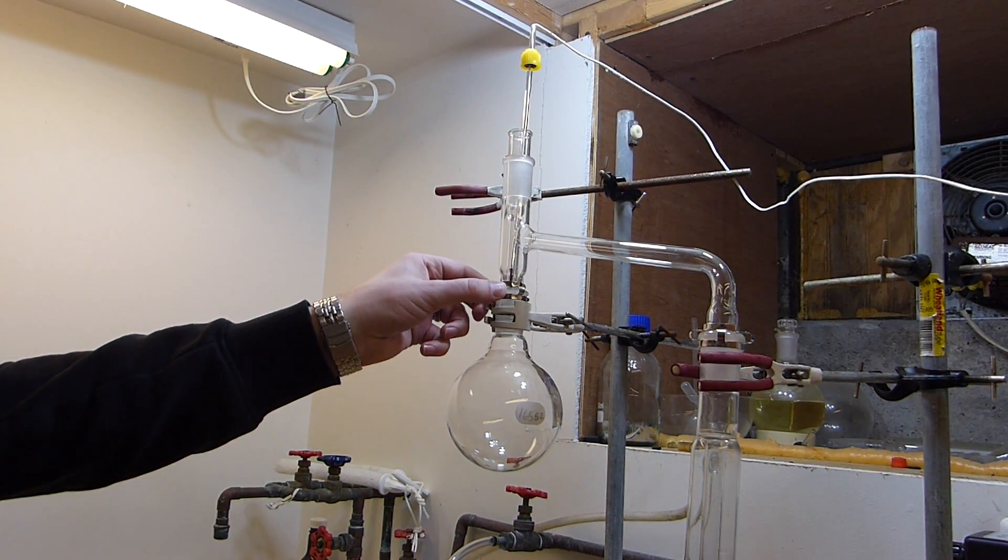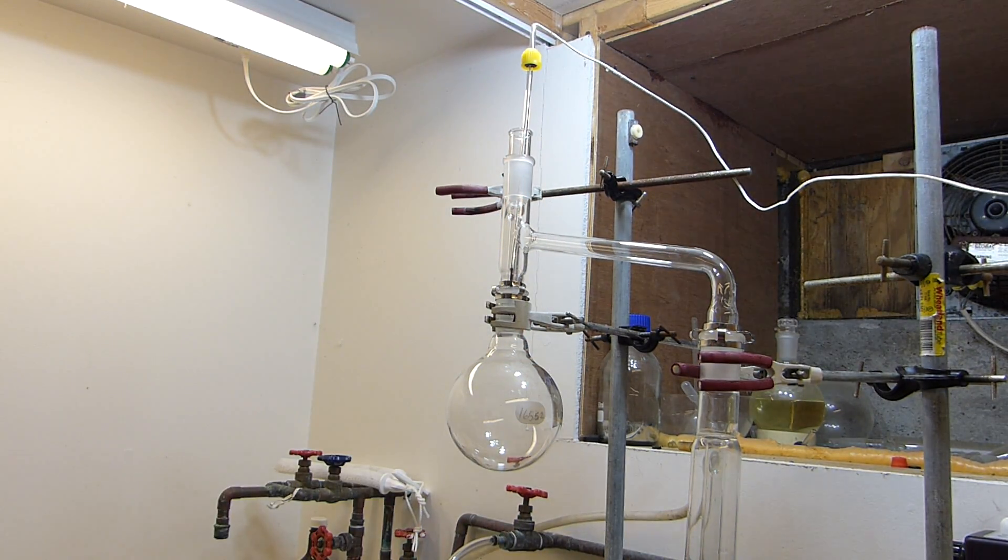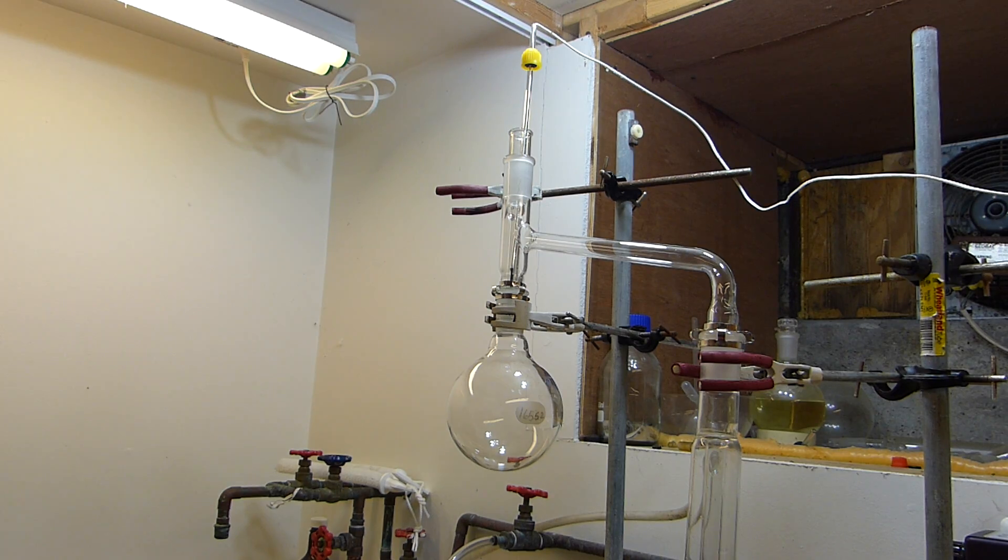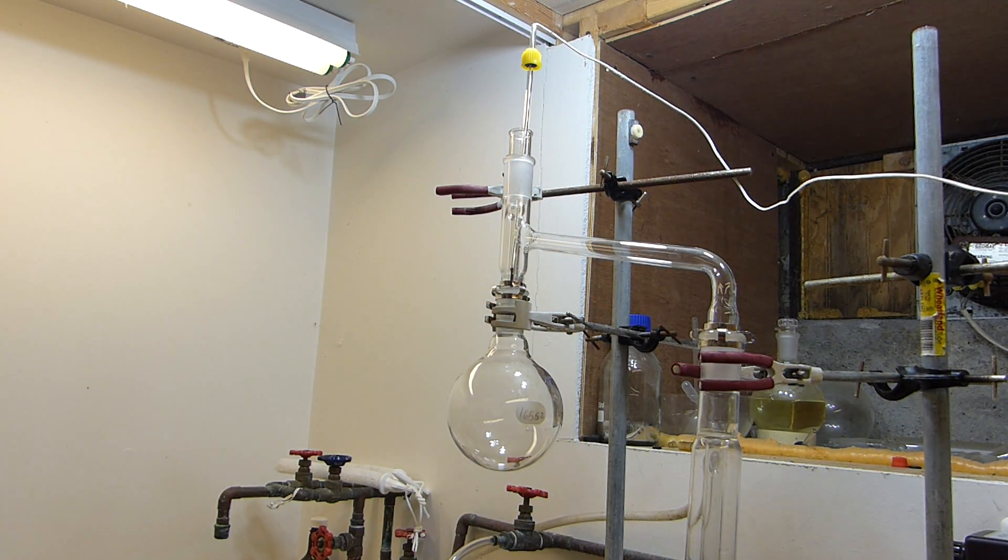I've also got these stainless steel Keck clips. You can see one here close up, and that's imperative to use because the plastic ones that I would normally use, such as this, they will easily melt at the temperatures required for this distillation.